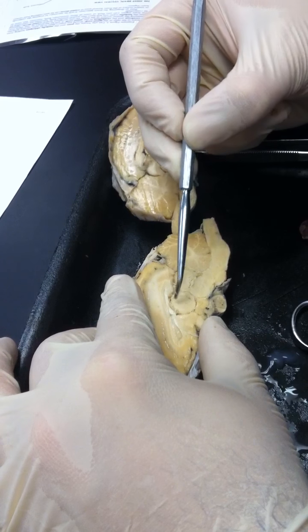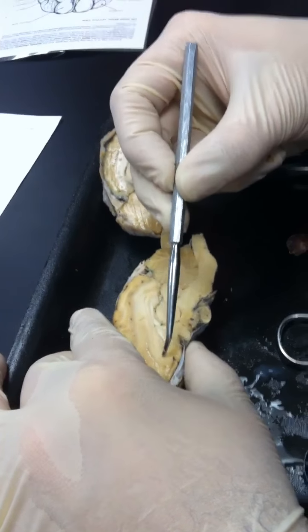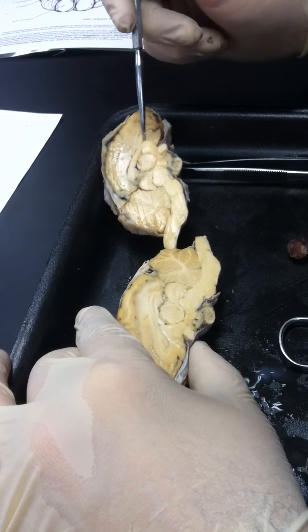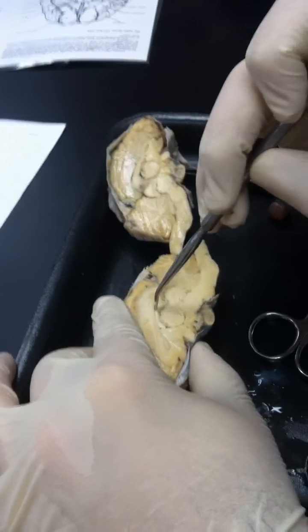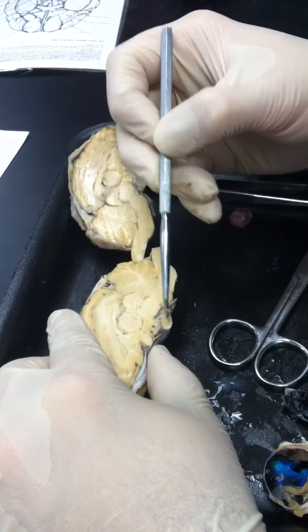Very good. Okay. Above the thalamus, you have this structure, which is the corpus callosum. You see it here. Corpus callosum. It doesn't look quite as good on sheep as it does in us, but it basically forms a downward-facing C. Okay. You see how it right here. Okay. All right.